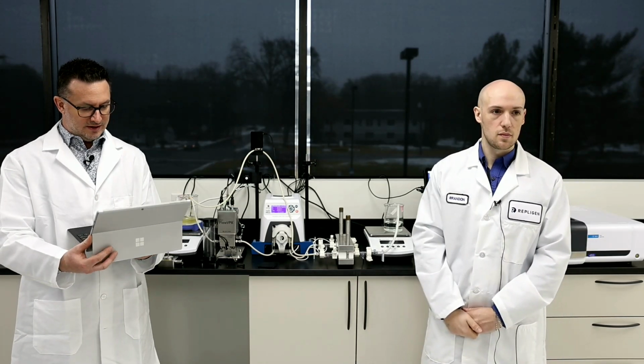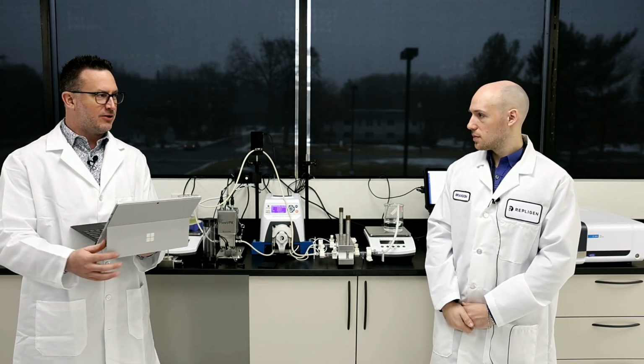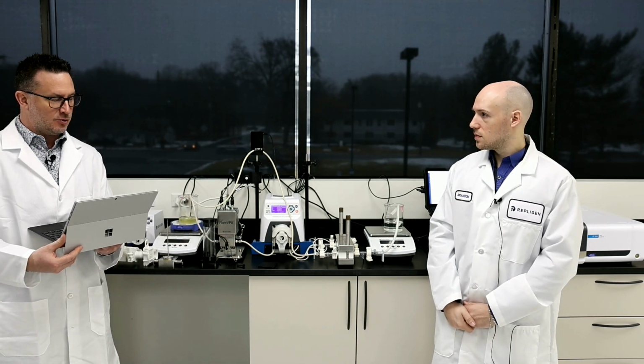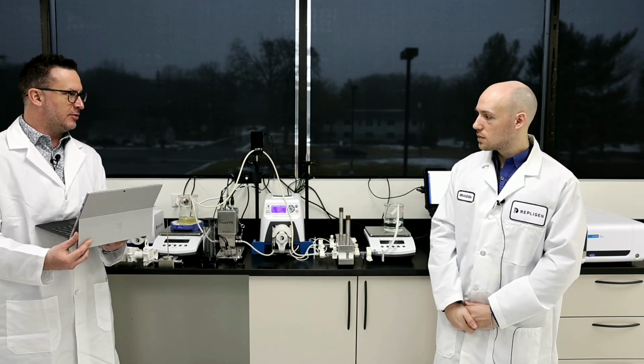Great, thanks, Brandon. I got one more question here, and it looks to ask about background correction. The surveyor has a question saying they do background correction normally with their measurements, and how do you accomplish this here with the RPM system?